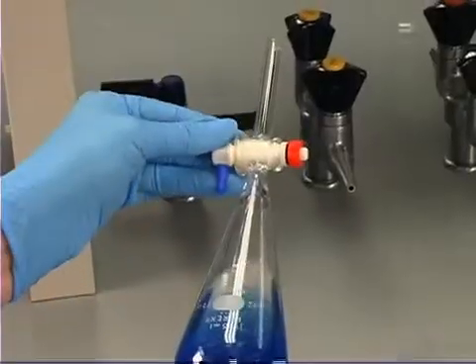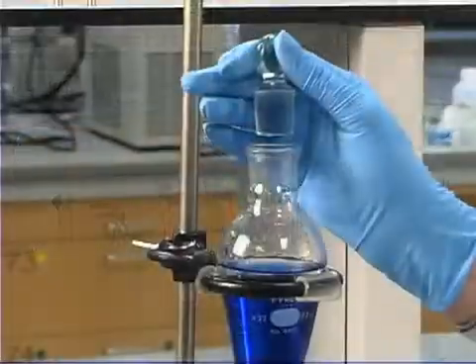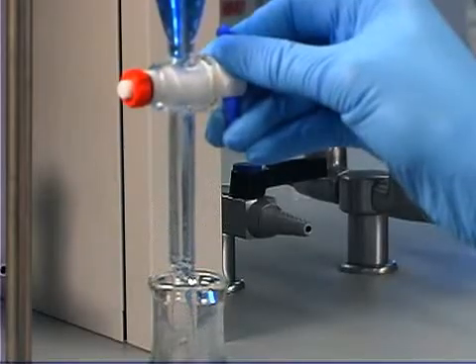Periodically, vent the sep funnel to release pressure created during mixing. To easily separate the bottom layer, open the stopcock and drain the bottom layer into a waiting flask.